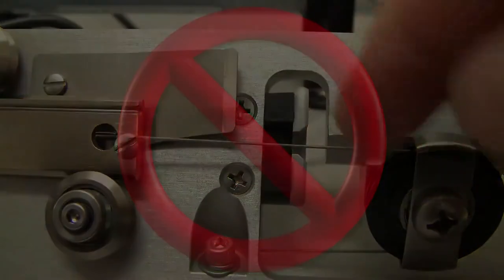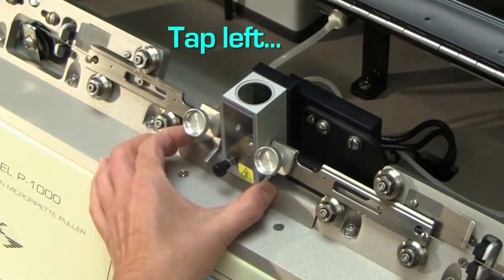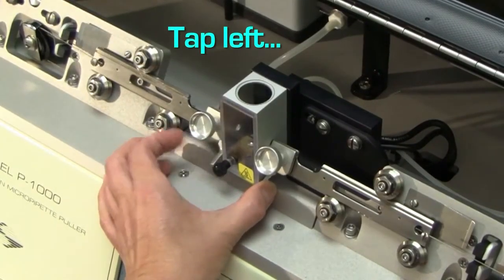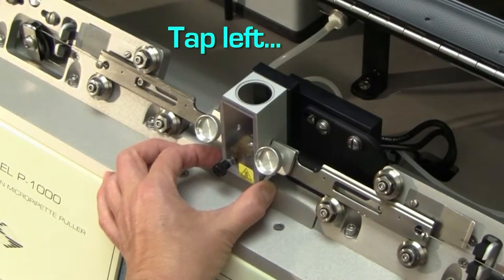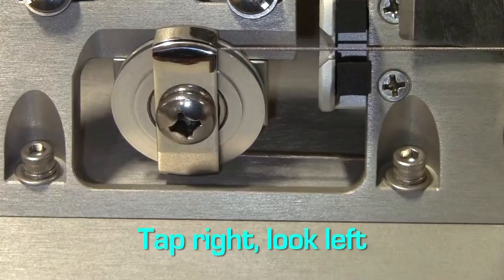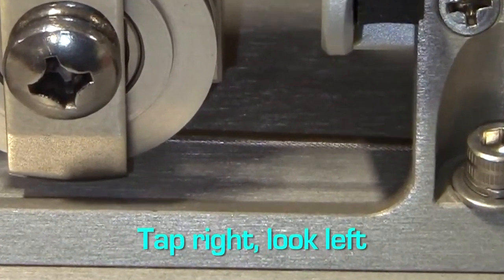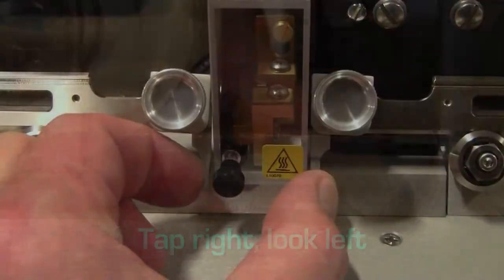The second aspect to check is that the amount of play is the same on both sides. Here are two techniques for this test. Pull the puller bars all the way together. Now tap one puller bar against the hard stop and watch the lower portion of the pull cable on the other side. You should see movement that corresponds to your tapping. Reverse sides and repeat. If you see the movement to about the same extent on both sides, you're good.